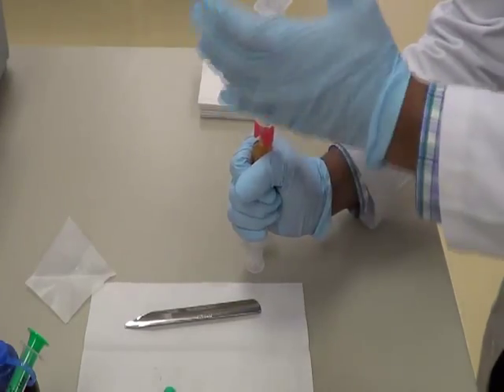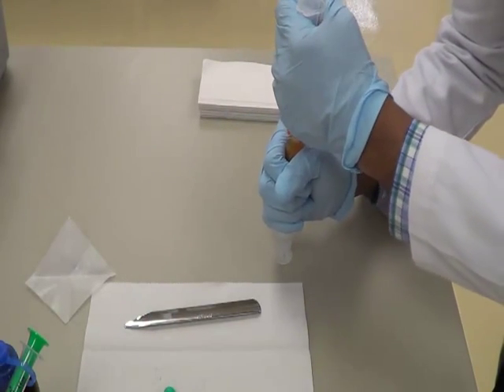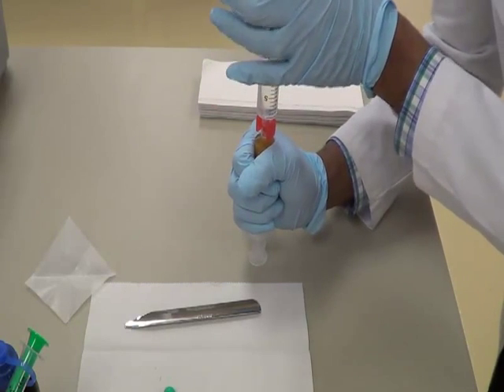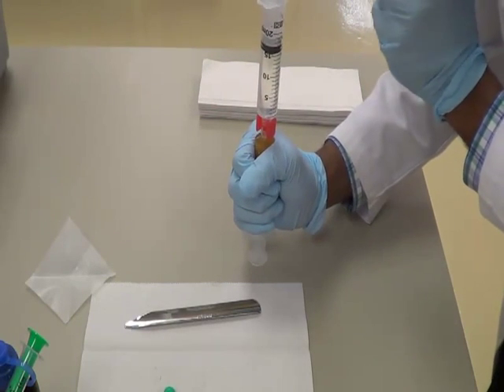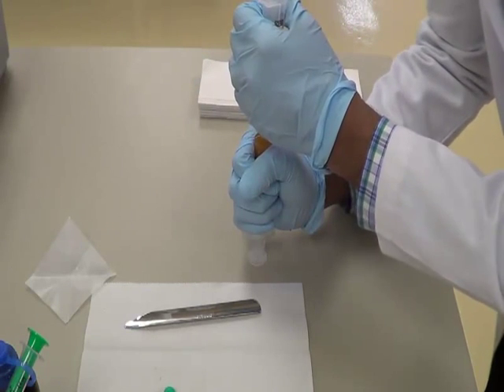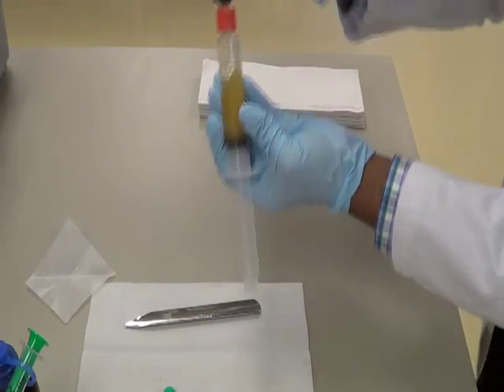Slowly hold your hand. Hold the bottom syringe with one hand and the top syringe with the other hand. Now slowly push your bottom hand down, gently holding the top one and the bottom syringe, push it down.